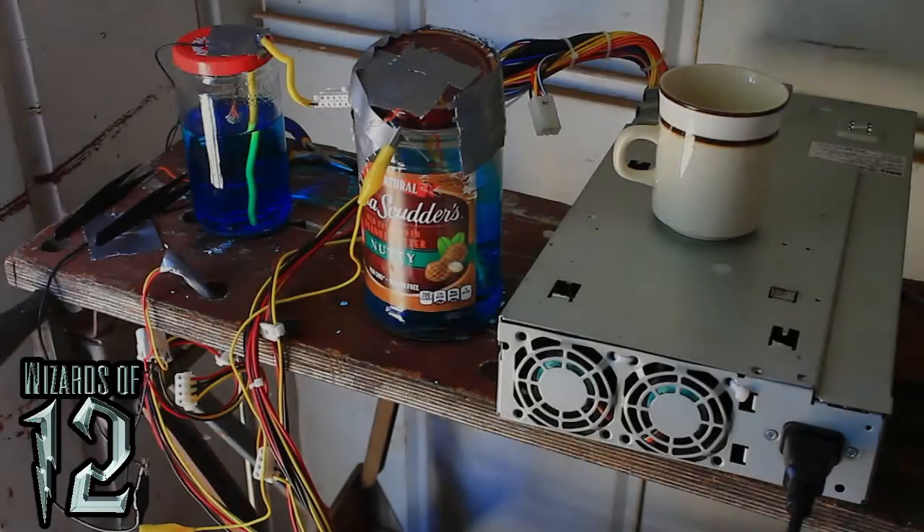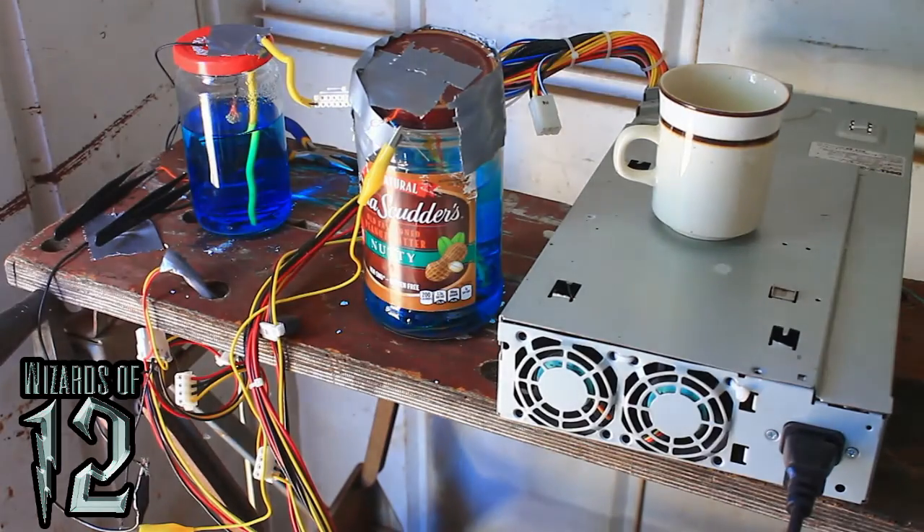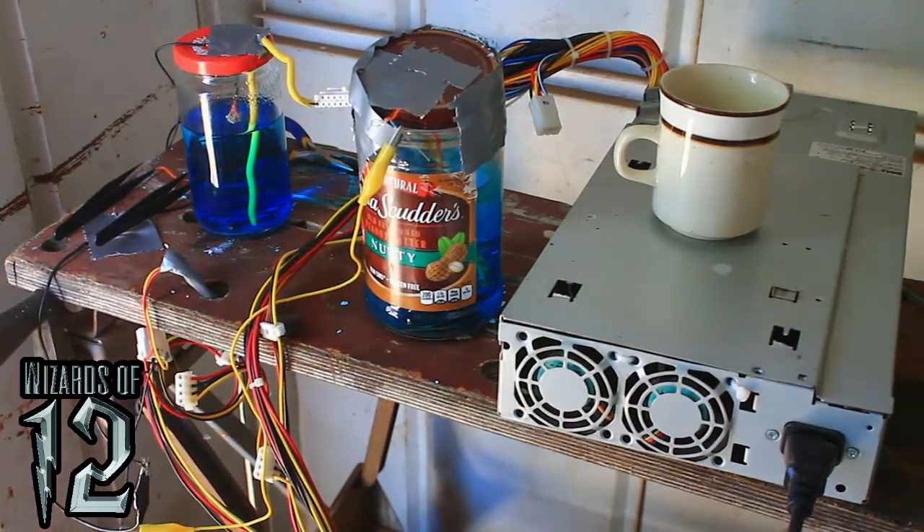What is up you guys. For the past week or so I've been growing these copper dendrites from copper sulfate solution. My power supply has been supplying 3.3 volts and I've been limiting the current with 226 ohm resistors.